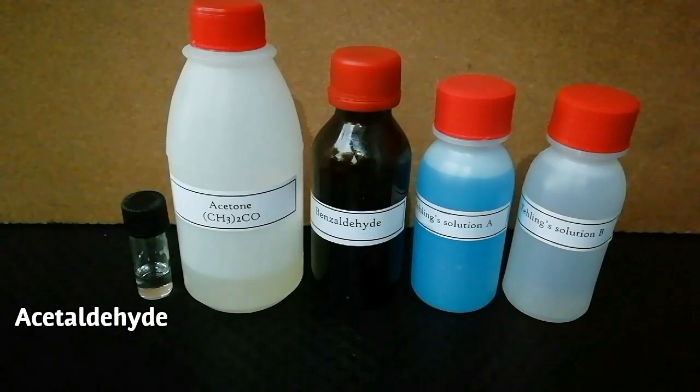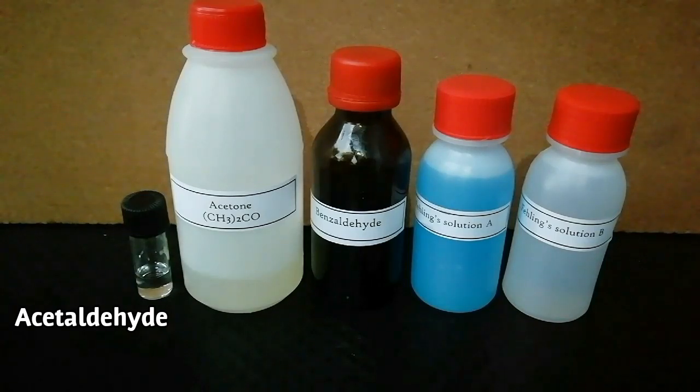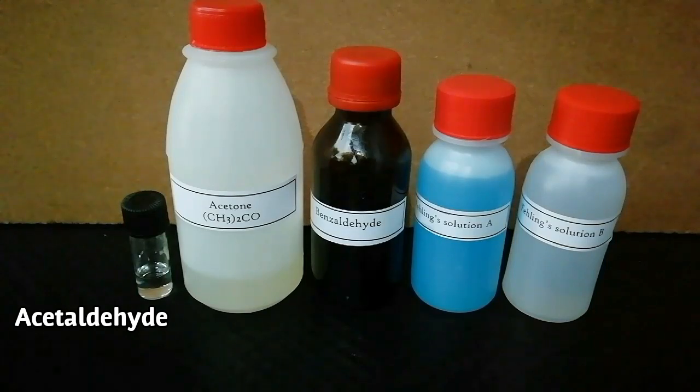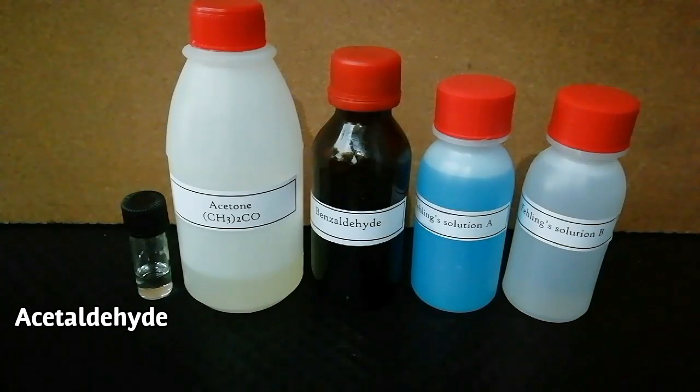Acetaldehyde, benzaldehyde, and acetone are used as the testing samples.